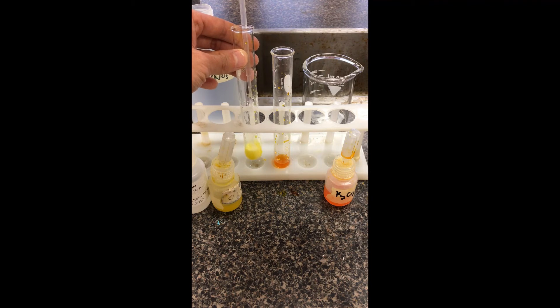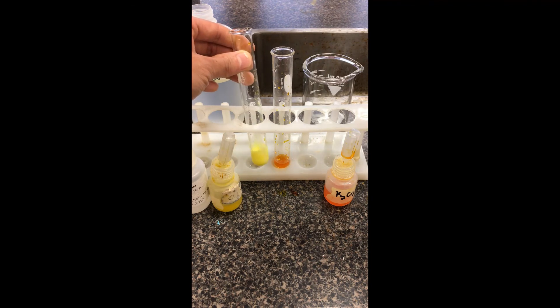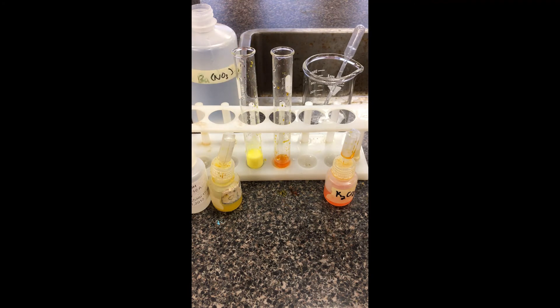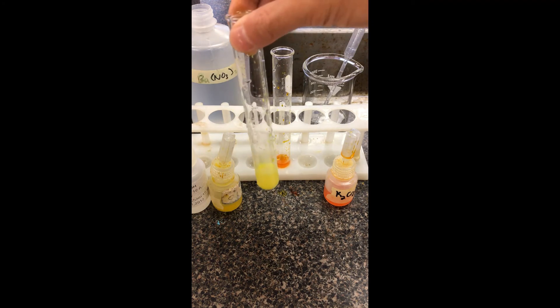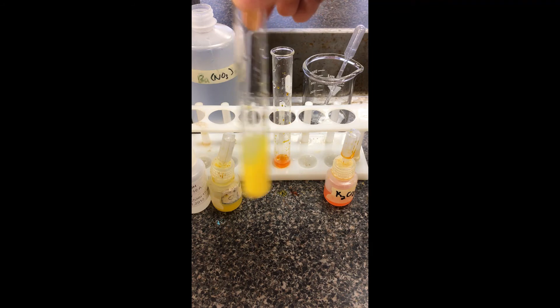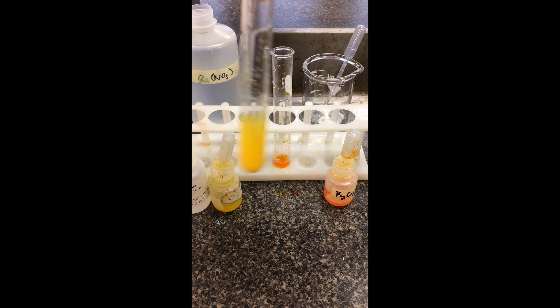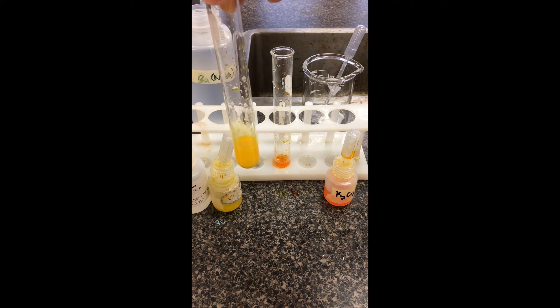You should find that it actually got quite a bit more murky. That murkiness is usually an indication that a solid precipitate has formed. Then we're going to add acid to figure out what happens — adding that one molar hydrochloric acid and noting any changes in color and changes in clarity.